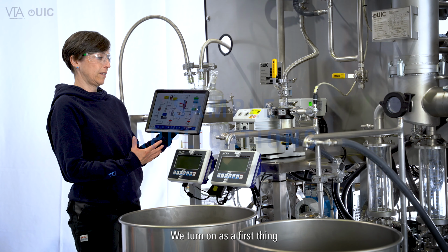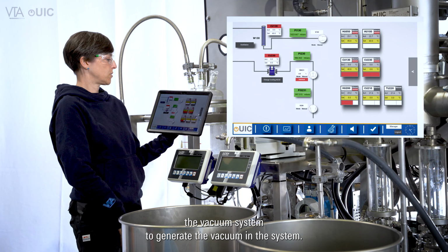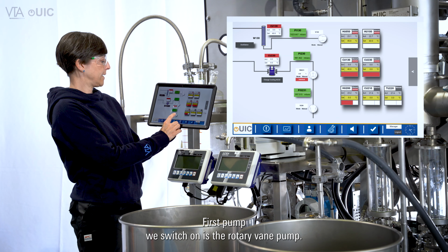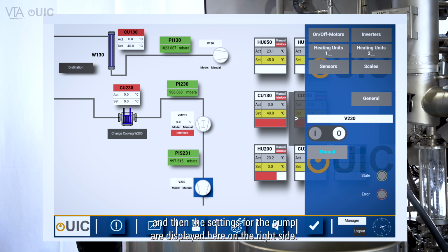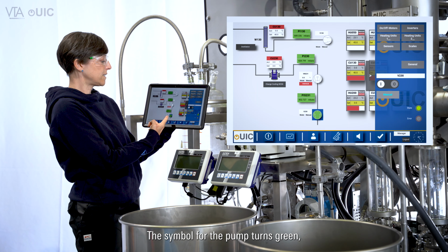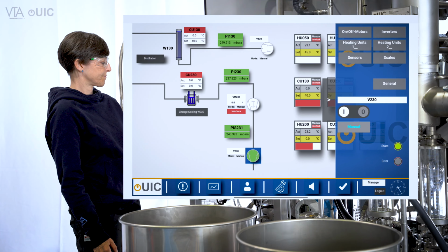We turn on, as a first thing, the vacuum system to generate the vacuum in the system. The first pump we switch on is the rotary vane pump. I just tap on the pump and then the settings for the pump are displayed here on the right side, and I just start it. That's it. The symbol for the pump turns green so that I have an indication that the pump is running.